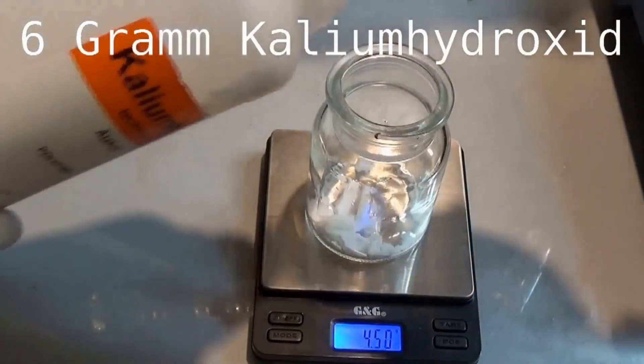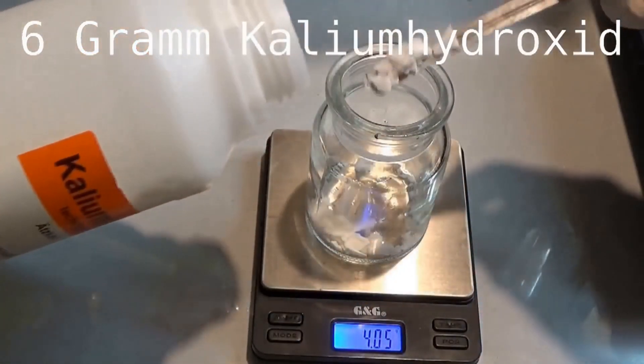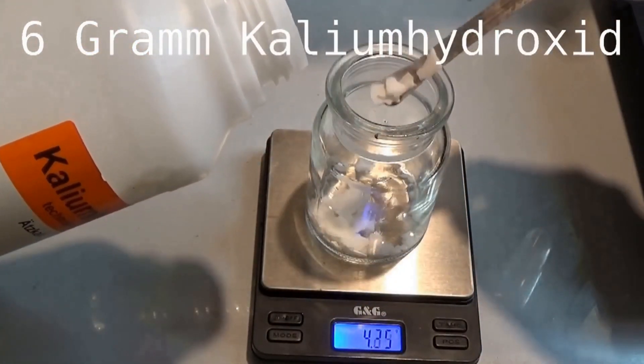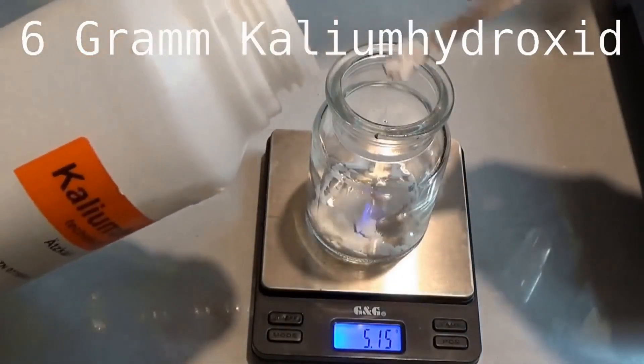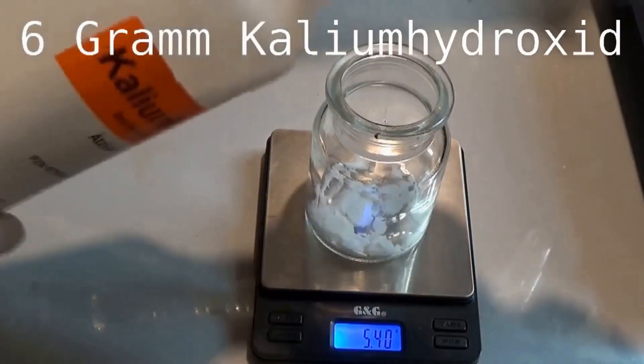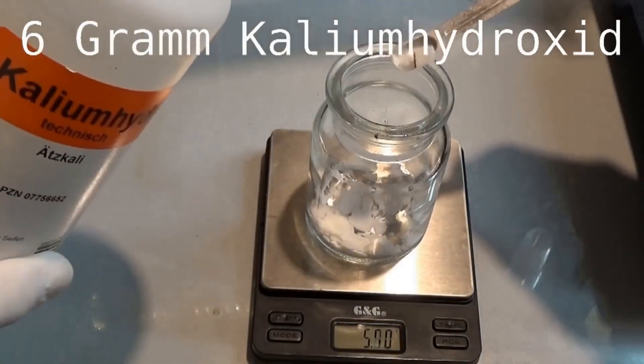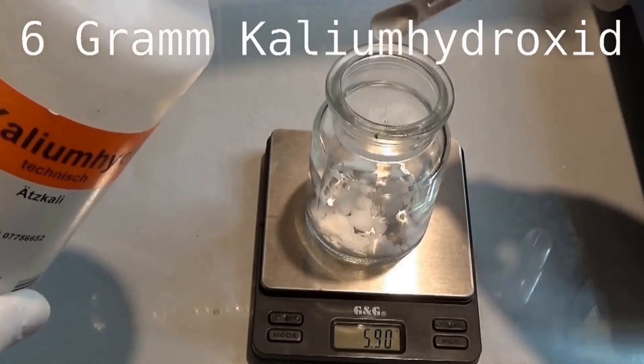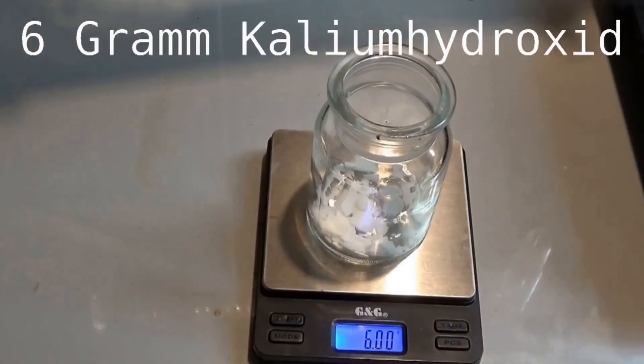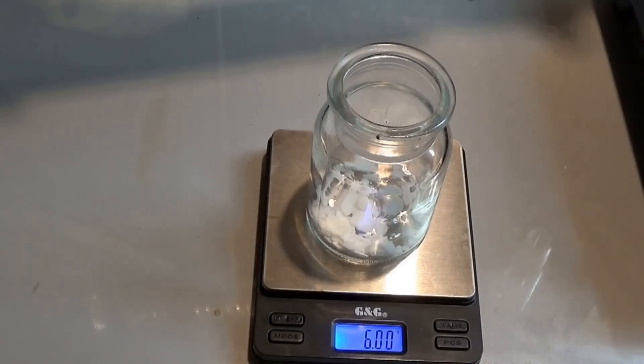The next step in the cleanup is the preparation of a saponification solution. This is done by solvating around 6 grams of potassium hydroxide in 50 milliliters ethanol. You can also use sodium hydroxide instead of potassium hydroxide, but there may be a slight difference in the appearance of the resin and fat soaps. I also dried the ethanol over three angstrom molecular sieves, but that is optional.